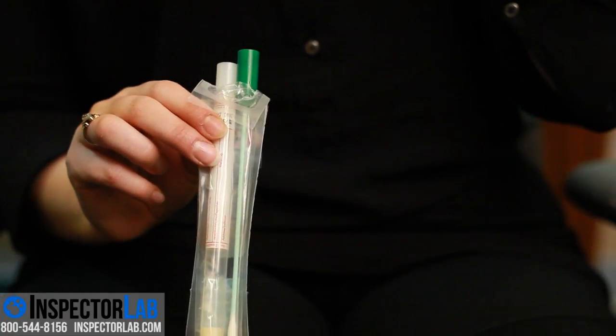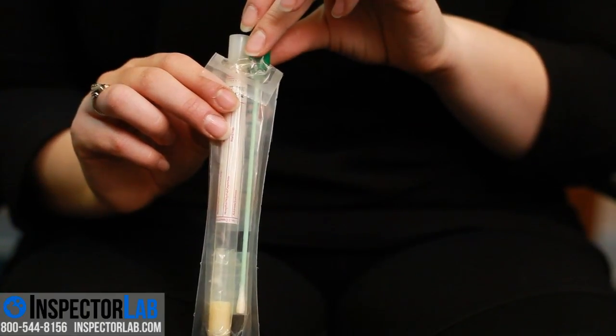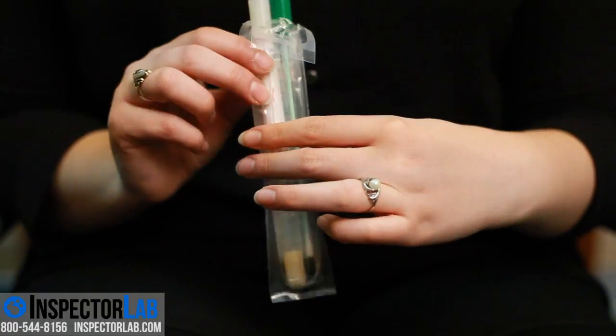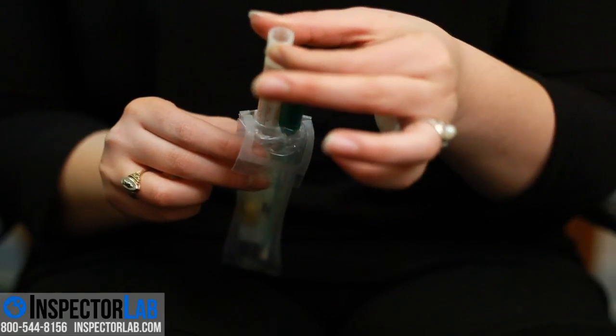Most indoor mold swab samples are not taken to test if the mold is alive. Most swab samples are used to test the presence of mold and if it is growing now or has grown and is a source of mold spores in the air. Thus, it is not necessary to use gloves when taking a swab sample.